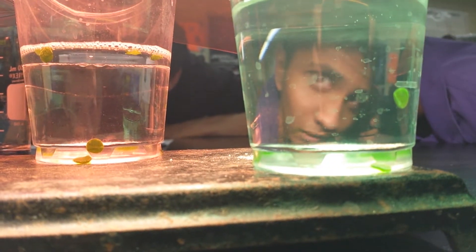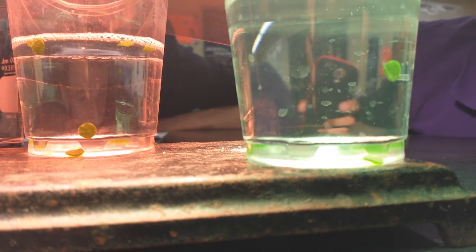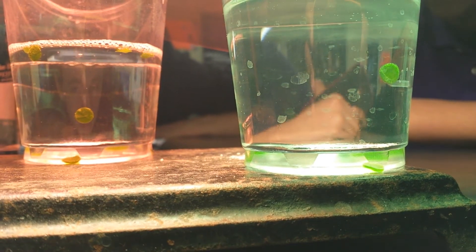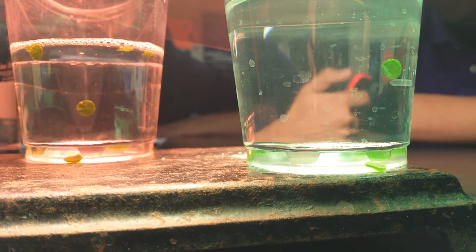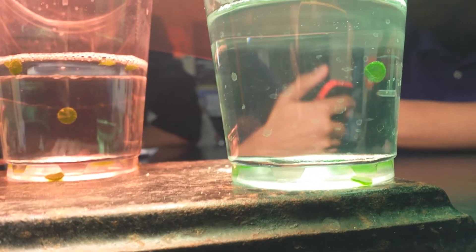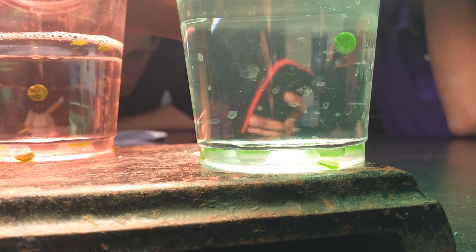Green is pushing. I don't see it. I bleed green. And another red. Wait, no, it's stopped. Is it gonna go back down and go back up like the last one we did? It's going. It's going. It's going down. Oh, okay.